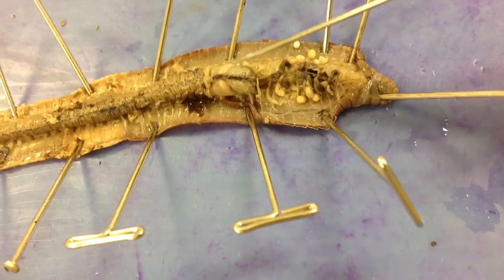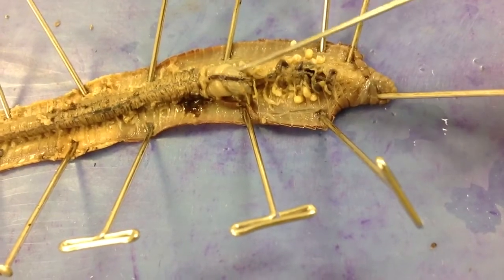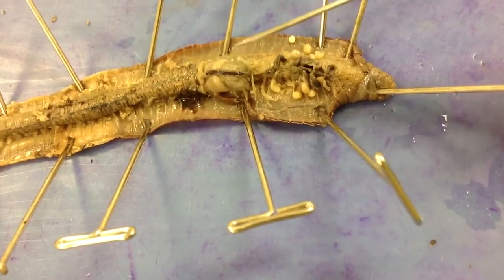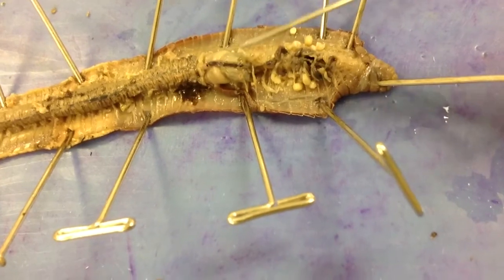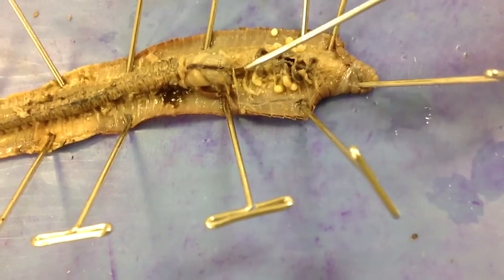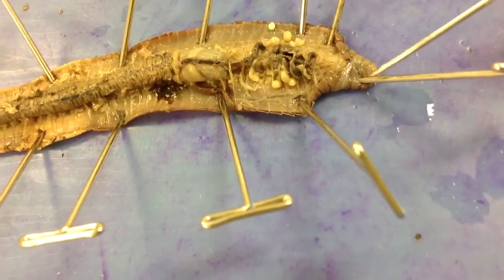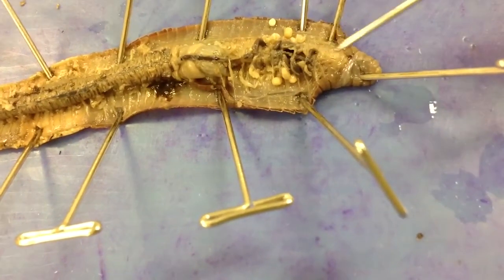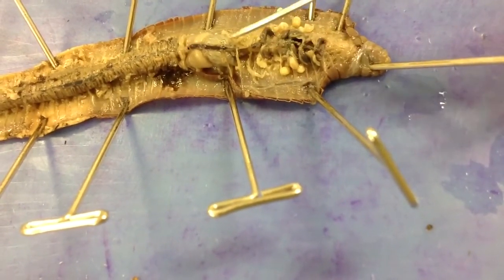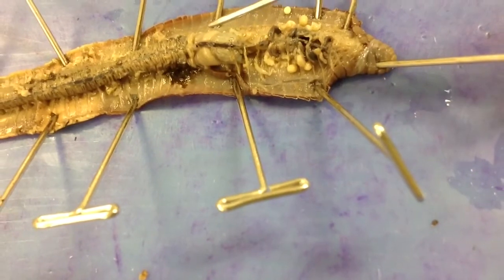The esophagus leads into this grayish-round structure right here called the crop. And if you notice as I'm pushing on it, it's soft and some other stuff kind of comes out of it. The crop is a hollow storage facility. As the worm goes through the soil, it takes soil and whatever's in the soil into its mouth, and it passes through the pharynx, esophagus, and into the crop where it's basically stored.